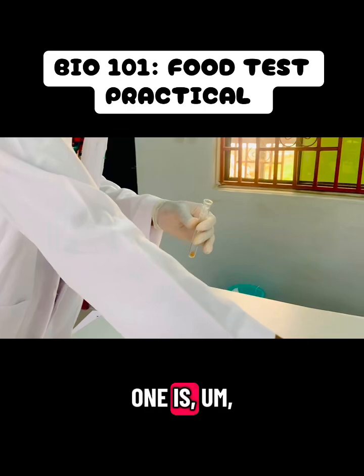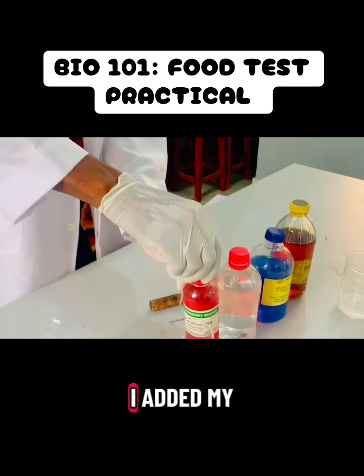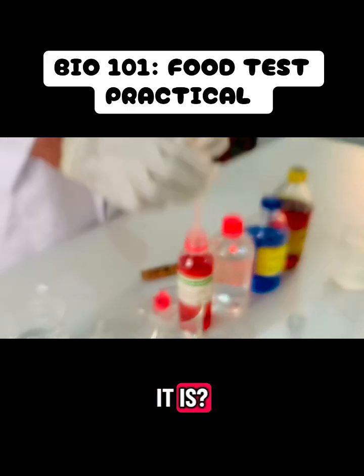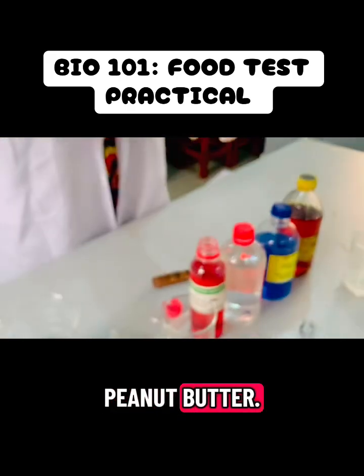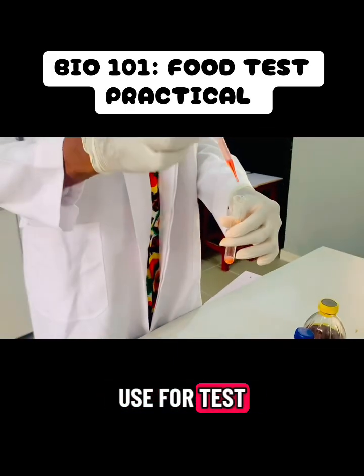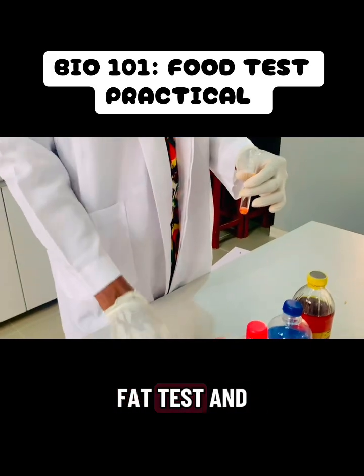So the next one is the test for fats. Yes, so for this I added my food sample. Yes, should I tell you what it is? Okay, let me try. That's just peanut butter. Yes, so I go in with my Sudan III test. That's what we use to test for fat. Sudan III test. You can also do the emulsion fat test and all of that.